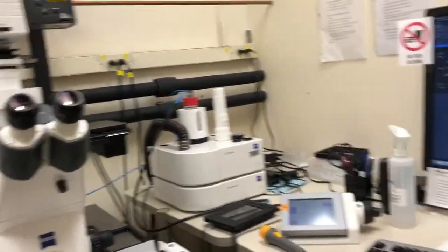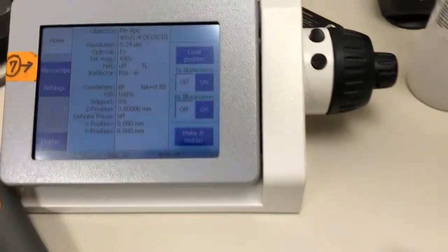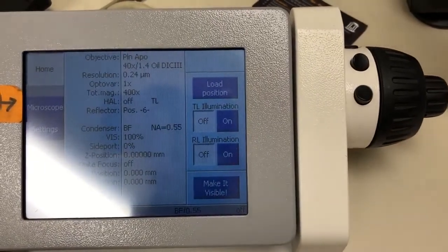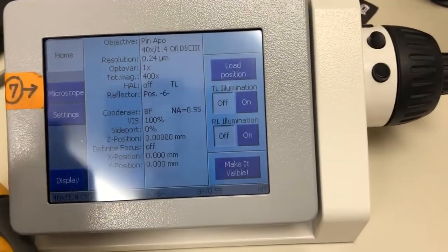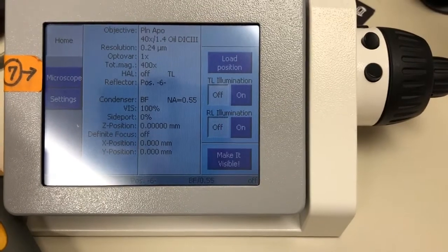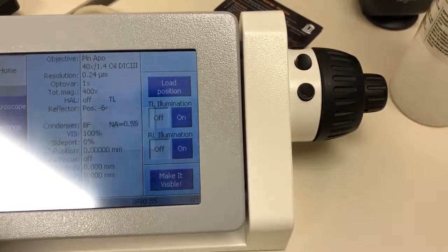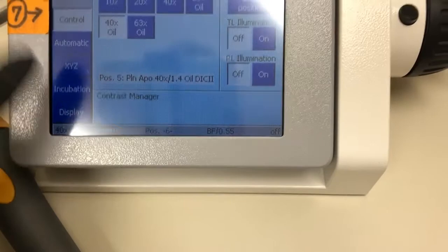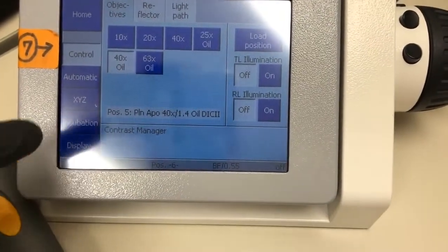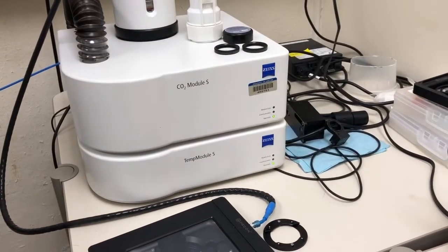The microscope has now been turned on. Everything is ready to go. I want to show you one thing that you can check to make sure that your startup procedure for the temperature controller works. I've refrained from pressing the microscope button because I want to show you that that is going to be slightly different after you've turned on the temperature controller. If you press the microscope button, what you'll see is that now there is an incubation button down here. You don't need to do anything with that, but just the mere presence of that button tells you that this apparatus, which controls temperature and CO2, is working properly.